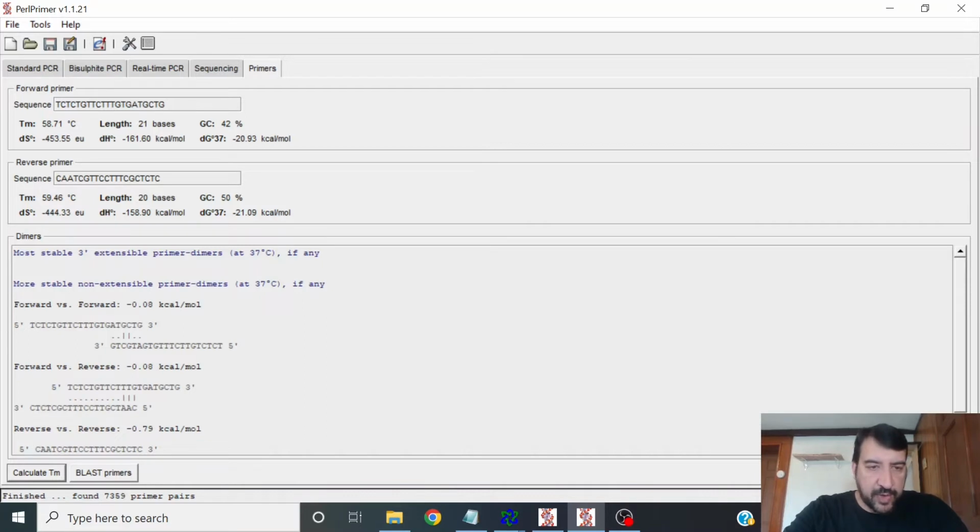So here the 3' end is actually not base pairing, so the G and the A don't base pair, and so this is not likely to extend. And this is an opposite example, and so you can't actually make DNA in this direction. So anyway, you see there's no extensible dimers, and the non-extensible dimers don't have a very favorable thermodynamics for forming. And so these could be a very good combination of primers to use.